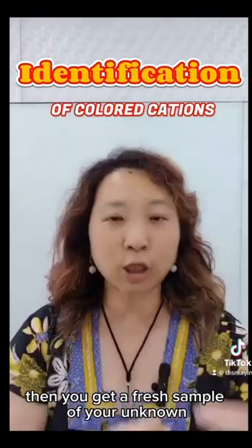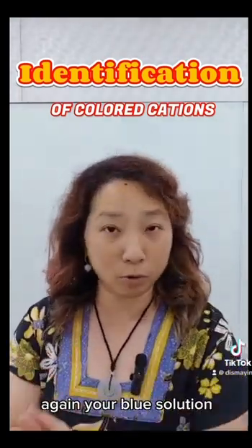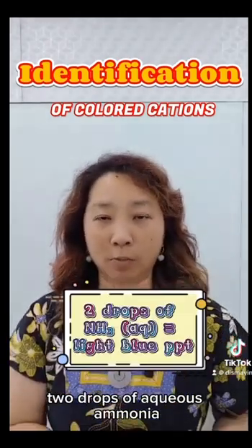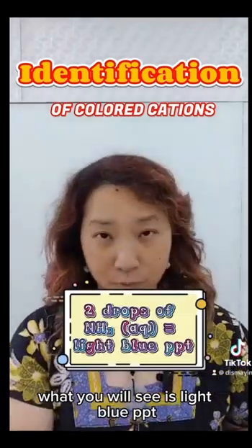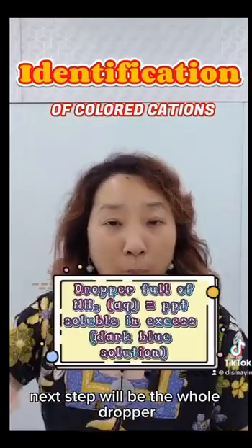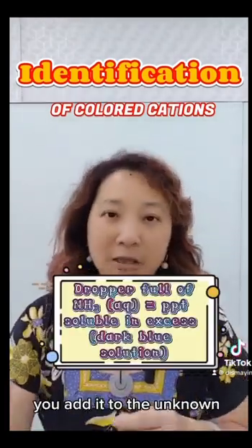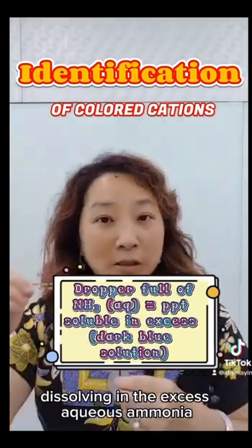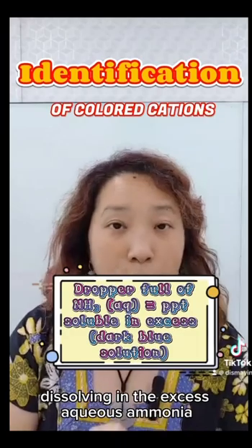So that's the first experiment. Then you get a fresh sample of your unknown, again your blue solution. Now you do the same with aqueous ammonia. 2 drops of aqueous ammonia. What you will see is light blue PPT produced again. And this time, next step will be the whole dropper full of aqueous ammonia. You add it to the unknown. What will you get? You will get the light blue PPT dissolving in the excess aqueous ammonia.